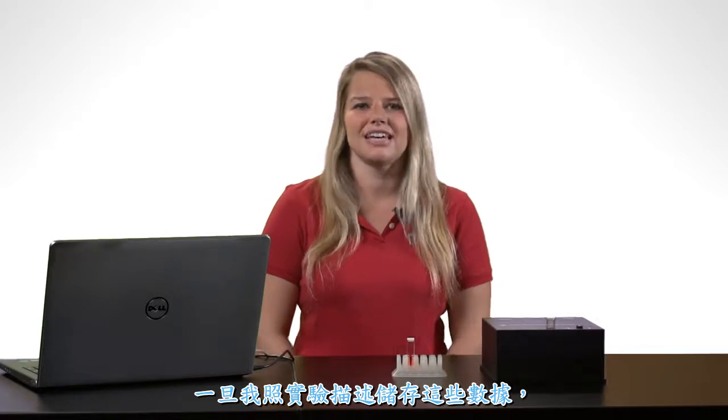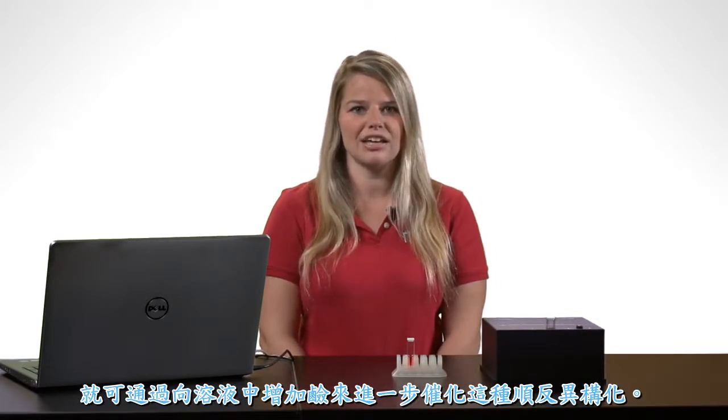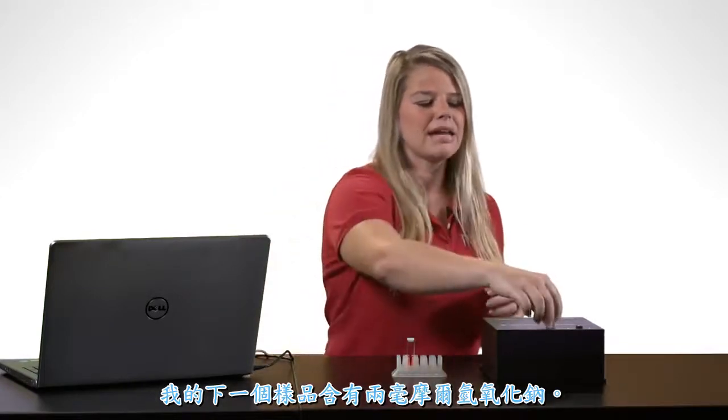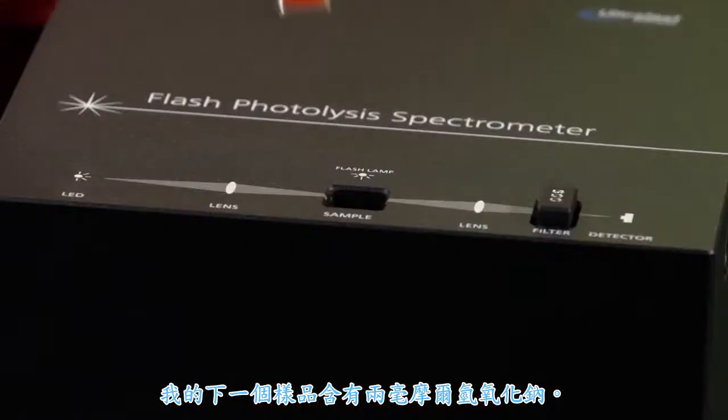Once I've saved this data, as the experiment describes, this cis-trans isomerization can be further catalyzed by adding a base to the solution. My next sample contains 2 millimolar sodium hydroxide.